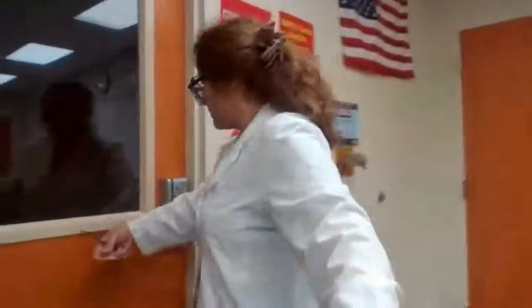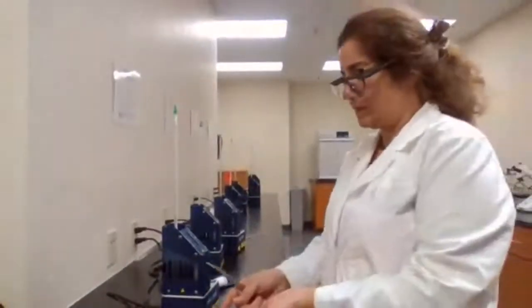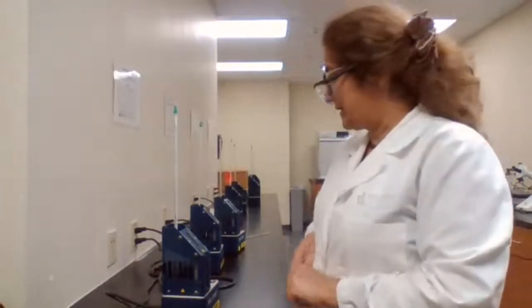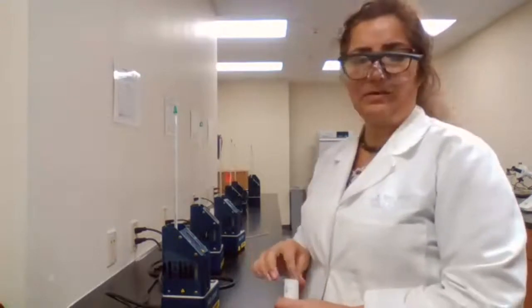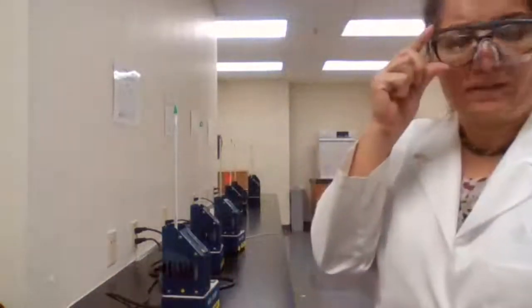I also got some of the ether, dimethoxybenzene, in another watch glass, so it's going to go to the instrument to measure the melting point. So if I'm measuring the melting point, which one should I measure first, the ether or the benzoic acid? That's my benzoic acid, and this is the ether.